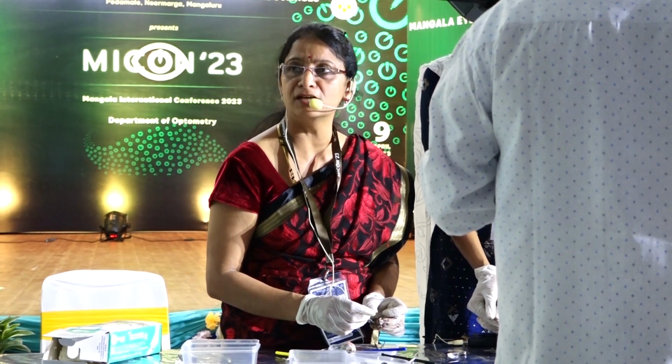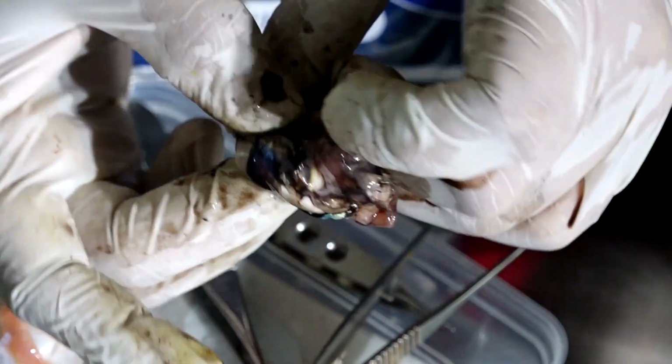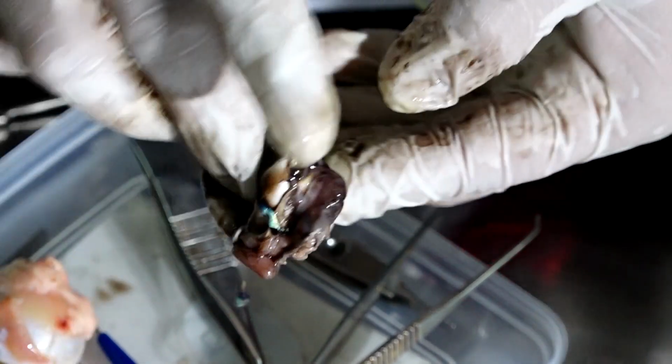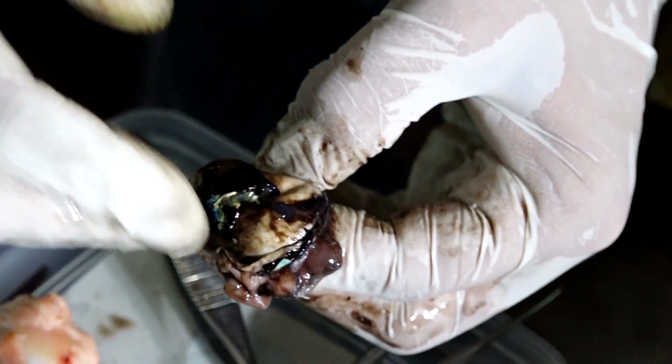Have you heard of optic nerve head? So if you now just trace back here, it exactly coincides with the optic nerve which we had seen in the beginning outside the eye. So inside the eye, it is the end of the retina, where all the retinal nerve fibers join.